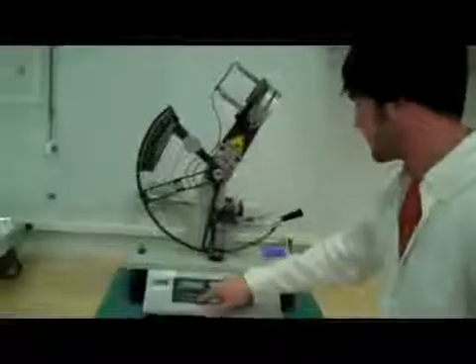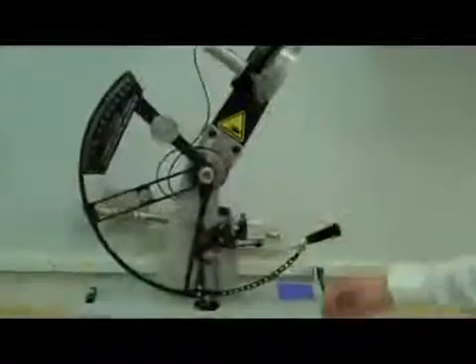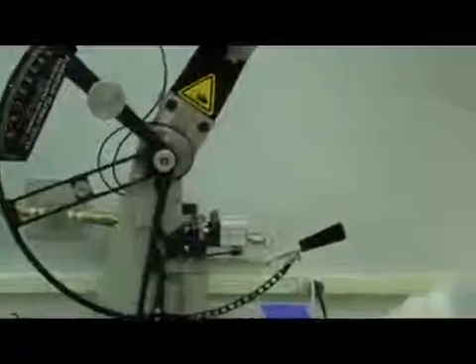Basically what you do is you load the sample into the grips, clamp it, apply a pre-cut to get rid of any edge effects, and then test.